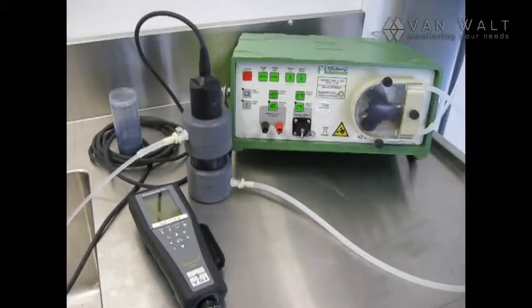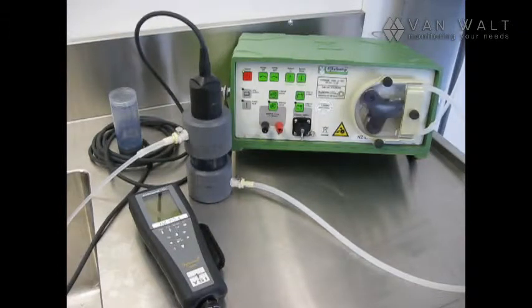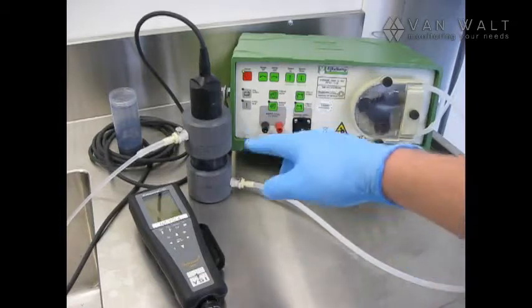So now what we're going to do is wait for our YSI to stabilize. And once we've reached stability, we're going to let the pump cycle three more times before we can take a sample. So three cycles, approximately three minutes, that's 600 mil. And that's the volume of the pump equipment itself, the tubing, the flow cell.